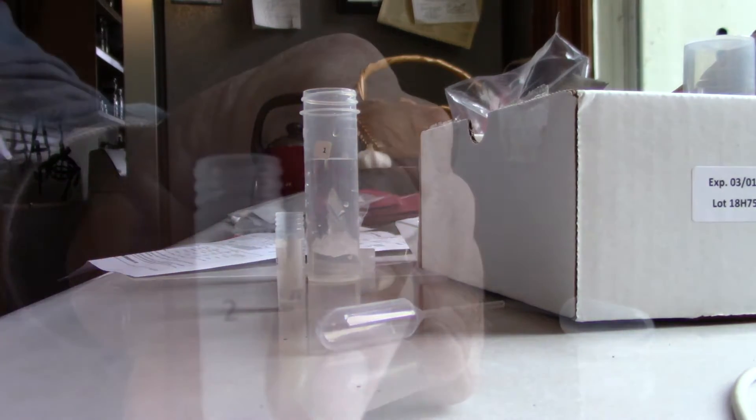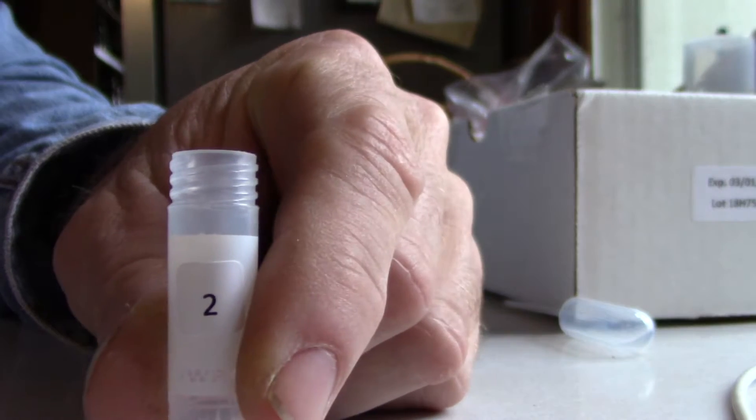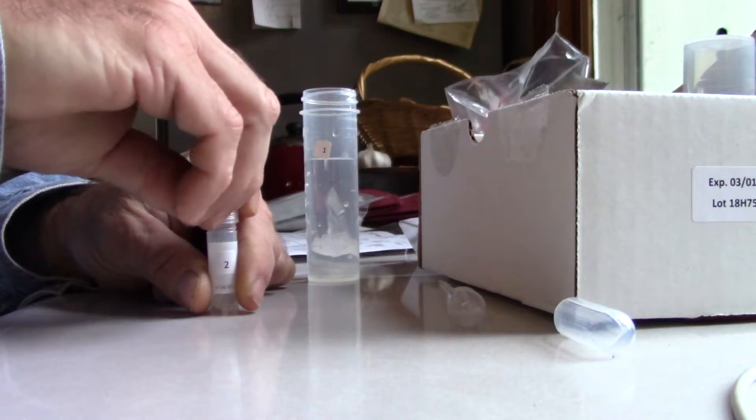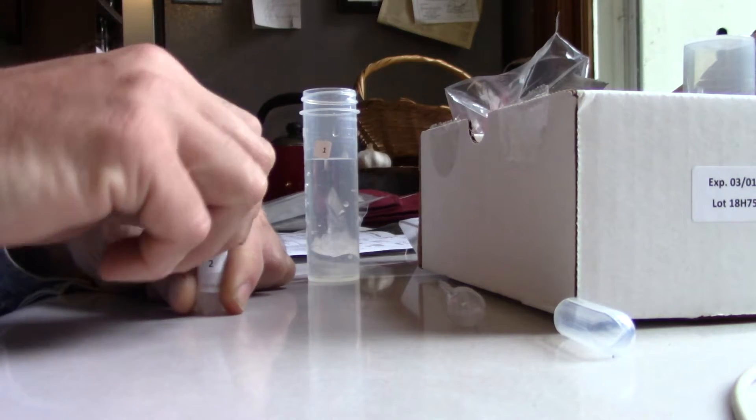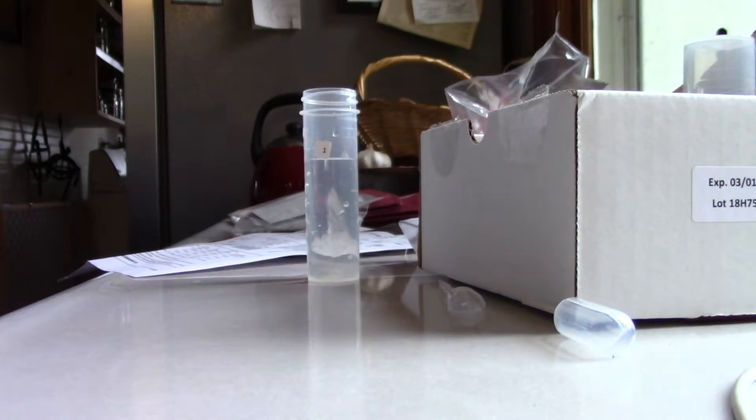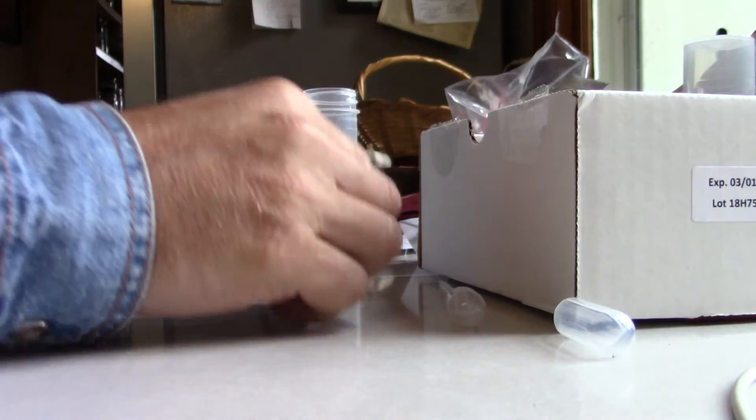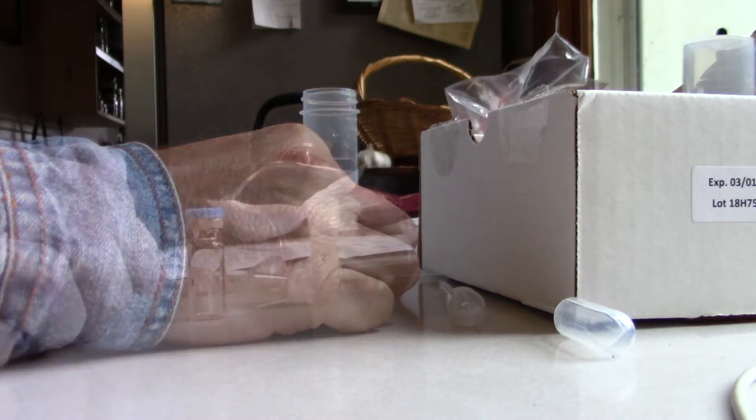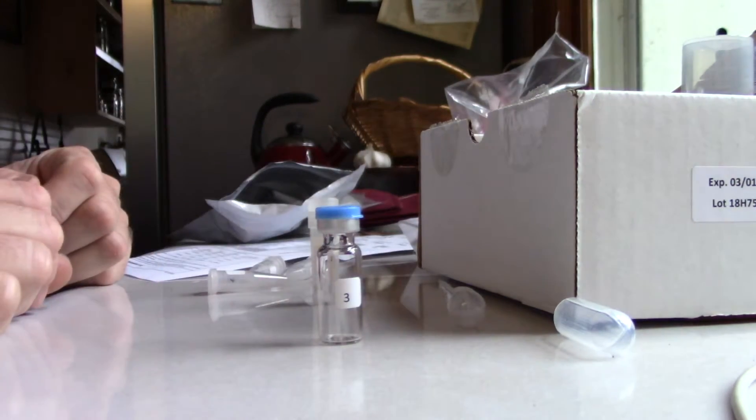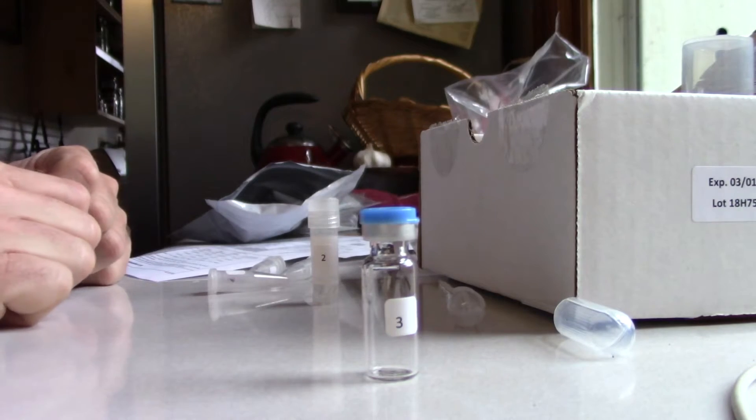Okay, the water is now in vial number two, so now shake for 30 seconds. Okay. All right, there's a real lab right here.